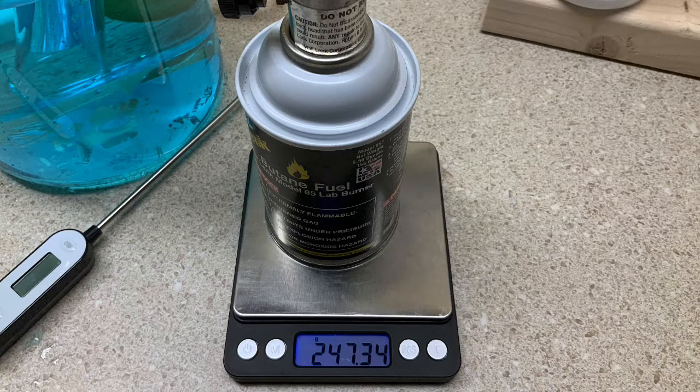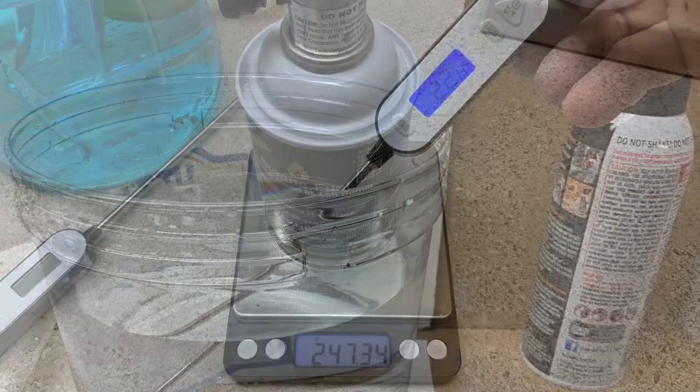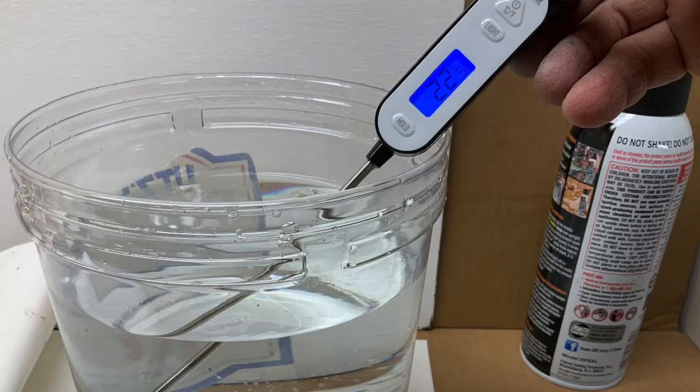Get your data table ready. We'll start this lab right off with a couple of measurements. First the butane canister and now the temperature.